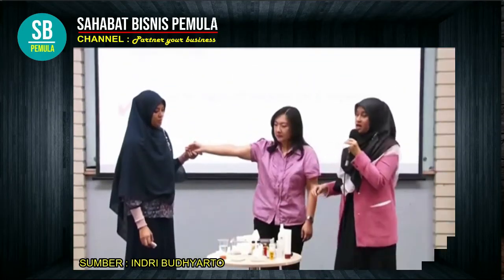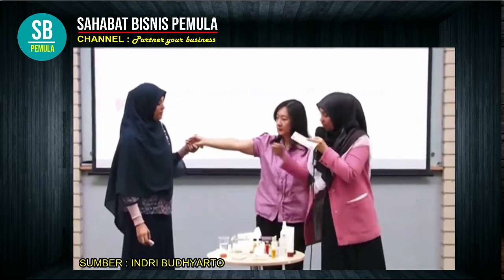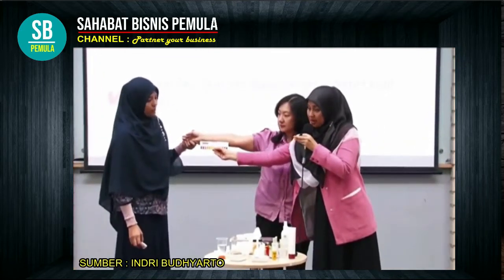To be practiced, you can use pencil pH. But if you want to test, you can use lakmus. This pH is from the human body, about 5.